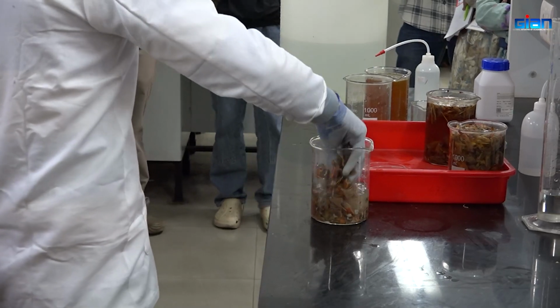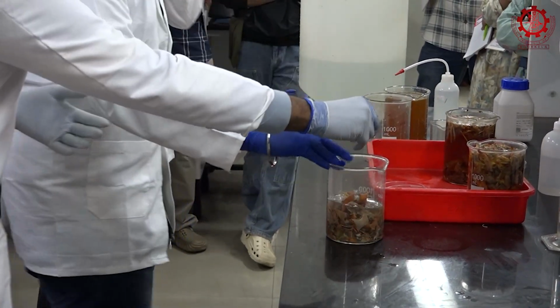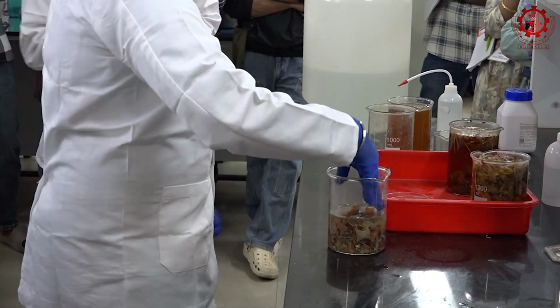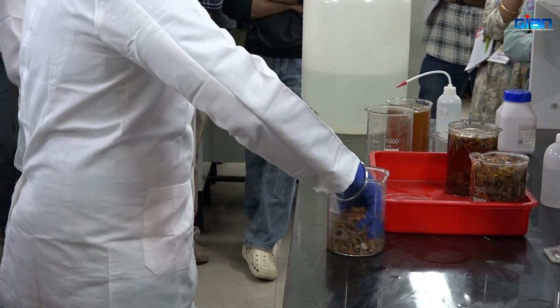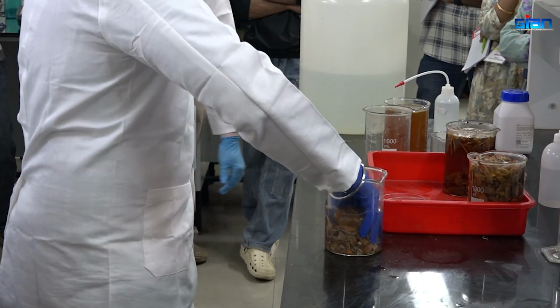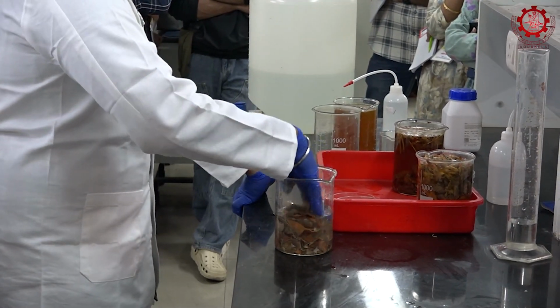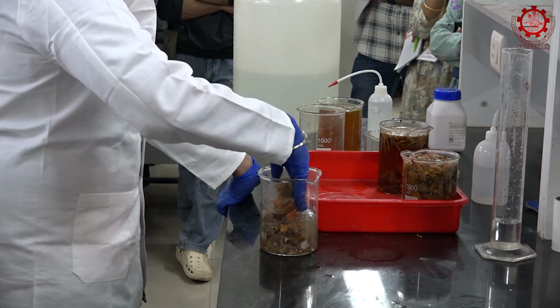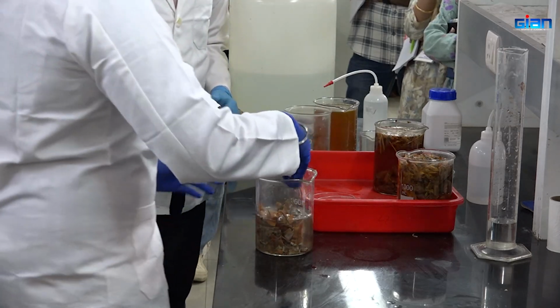So you can do it, and transfer it to here.